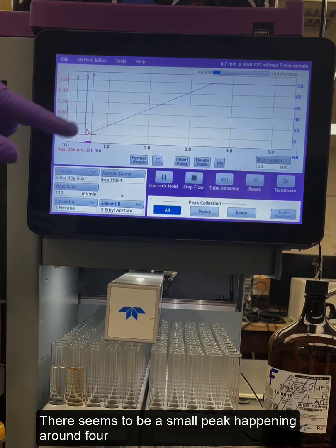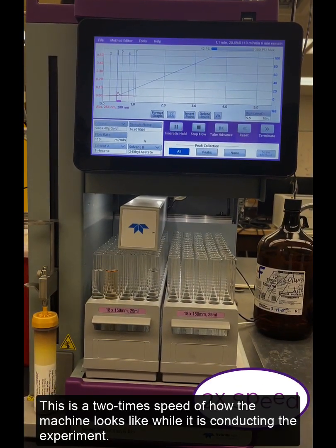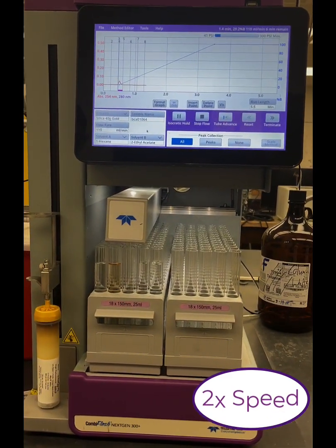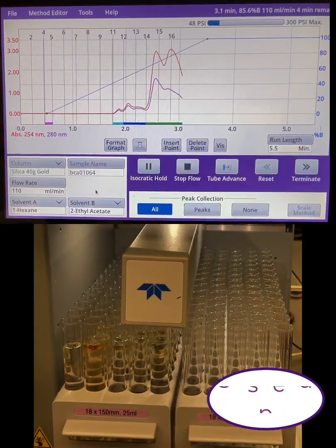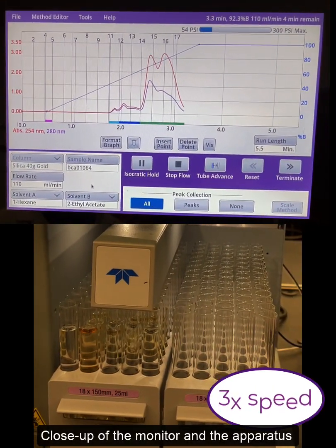It's going to be a two times speed of how the machine looks like while it is conducting the experiment. Close-up of the monitor and the apparatus which is performing the separation.